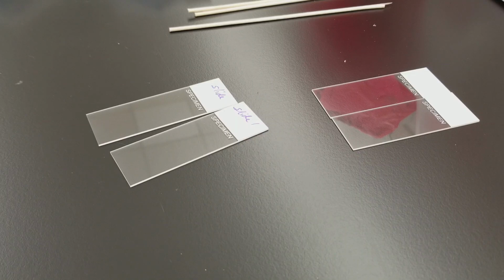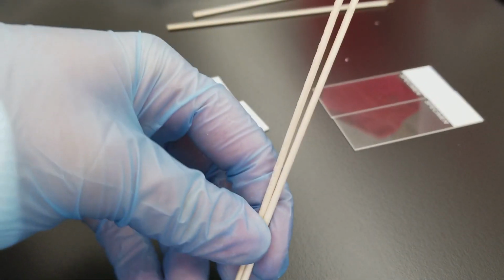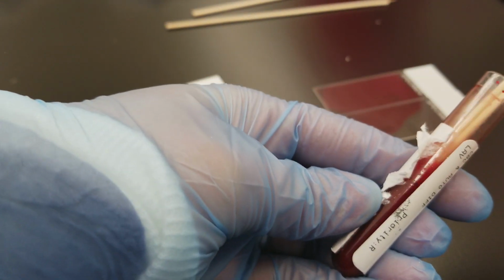Okay, so the cool thing about this was that the person was using clot checking sticks, which was really cool. It was something I'd never seen before. So the great thing about that technique is that when you use these sticks, you are able to clot check before you even pull the specimen out. So in that case, we would be doing this, right?